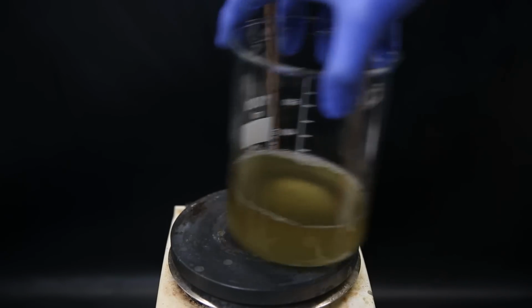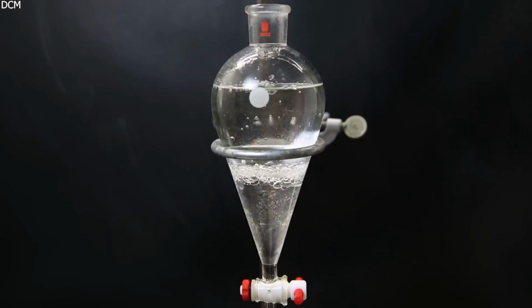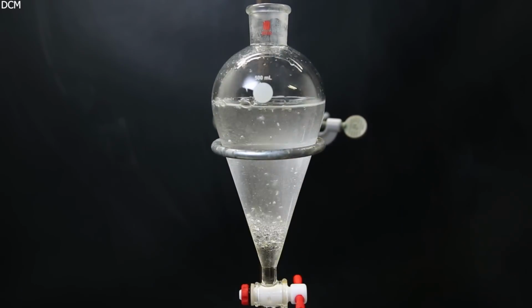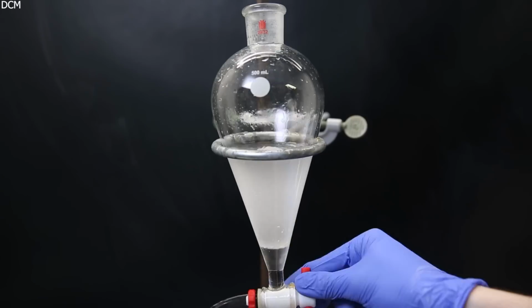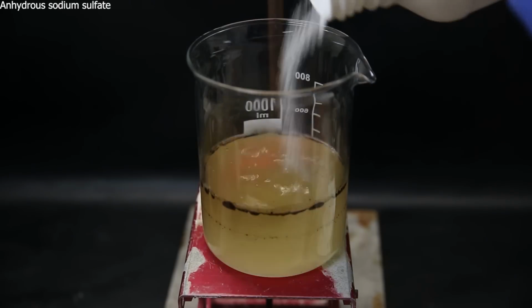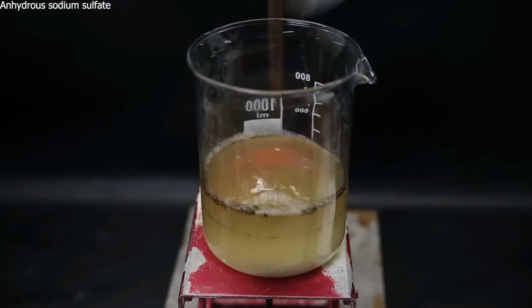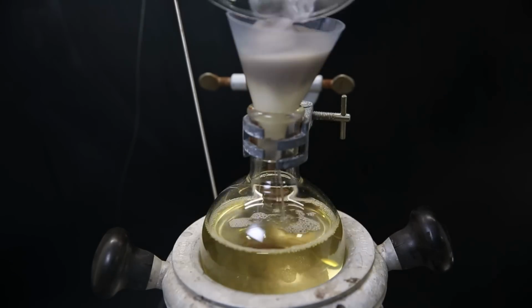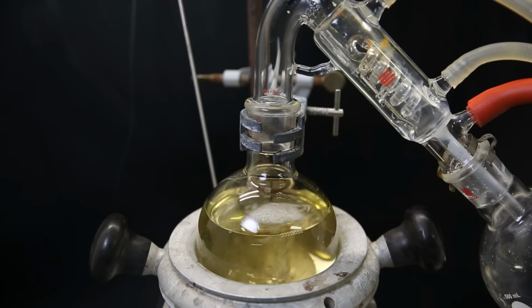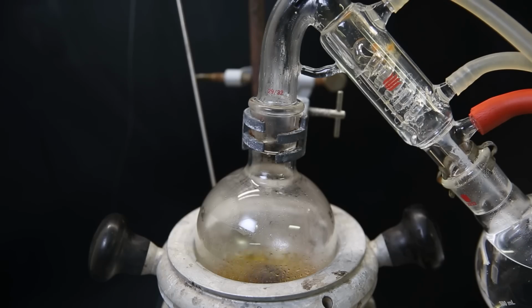I set it aside for a second, and then add the distillate from before to a separatory funnel. Since we saw it was steam distilling some of the product, and also it kind of smells like the product, I will extract it with DCM, to hopefully recover some of it. I then combine the extracts, and dry it with some anhydrous sodium sulfate, to take up remaining water. I filter it through some cotton, directly into a flask, and set it up for short path vacuum distillation, to first remove all of the DCM. When all of the DCM is gone, a yellow liquid is left behind, which should contain the product.